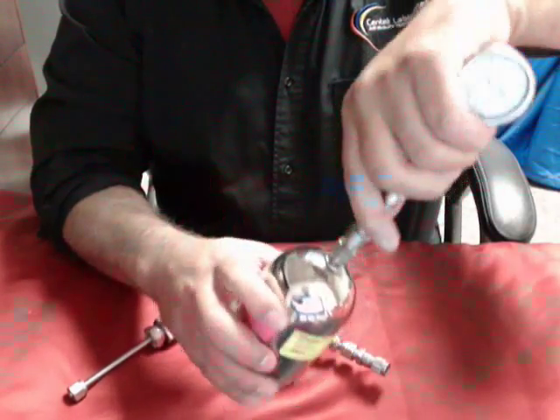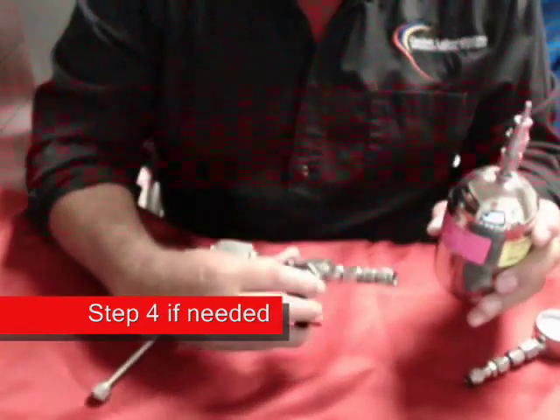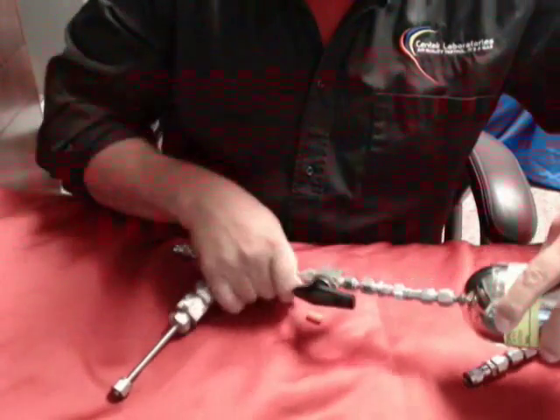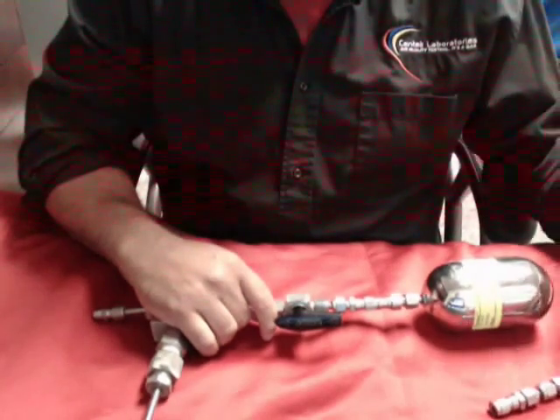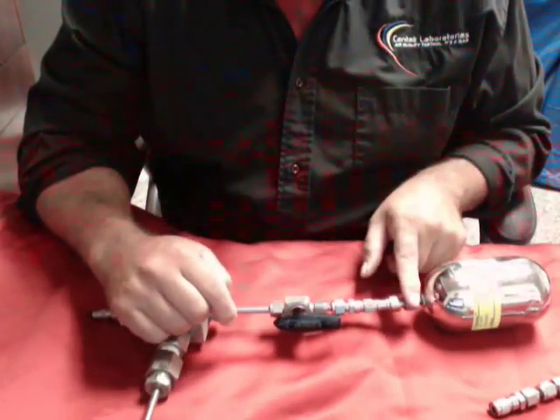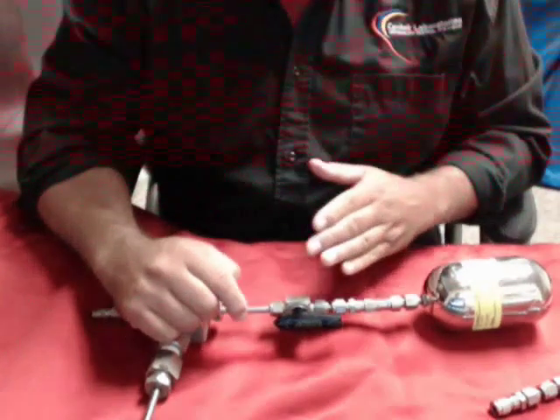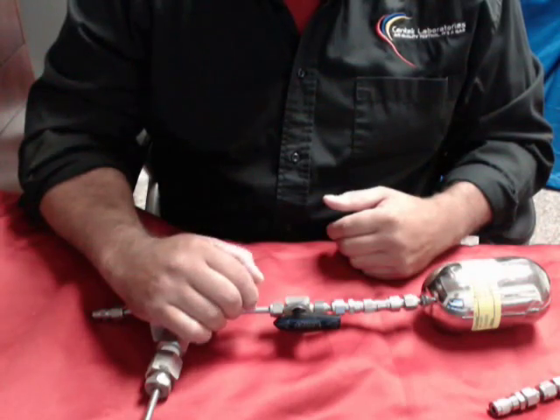What you're going to do is disconnect again, and even though we're still under vacuum, we're going to reopen the line, pull back on the collar, and let it collect. Under normal circumstances, if you're at 5 or 10 psi gauge coming into the system, it should fill up within 15 to 20 seconds. If it doesn't, you haven't failed — you just need to go back and pull another sample.